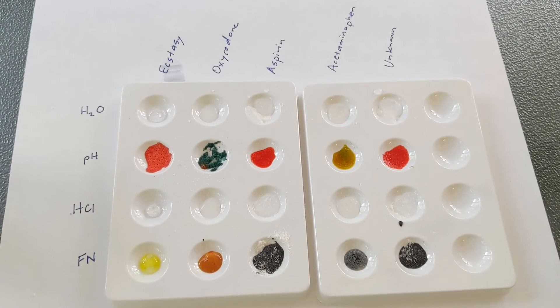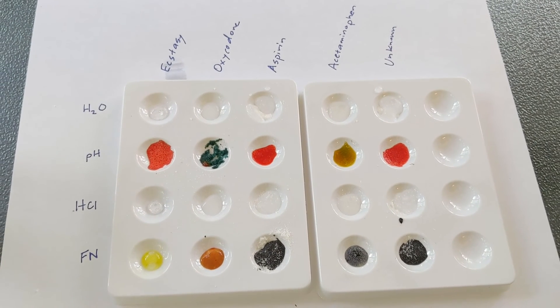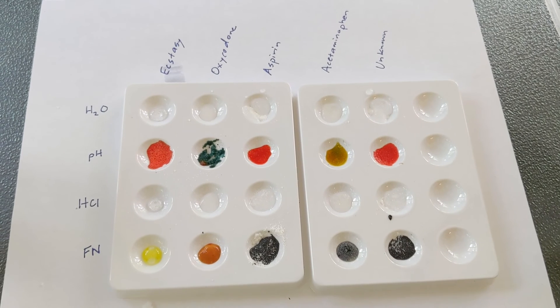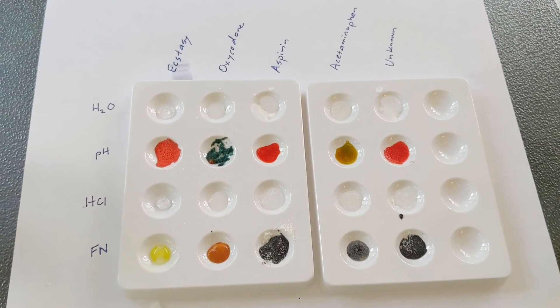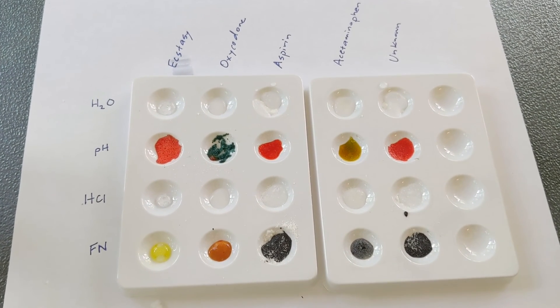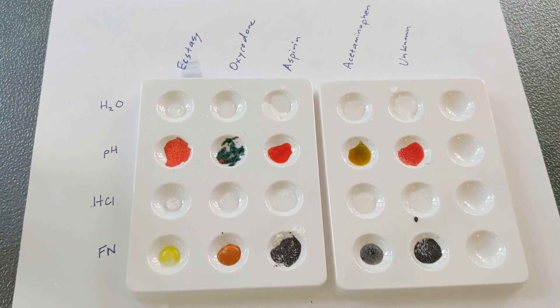Clean up your station. To do that, wipe out all of the wells with a paper towel, making sure the chemicals go in the trash can as best you can — it's better to have them go into a landfill than into the water system. Then thoroughly wash your plates, rinse them really well and allow them to dry. The toothpicks will need to be thrown in the trash and the little scoops will need to be washed and reused. Now you've had the chance to play the role of a forensic toxicologist and forensic chemist, and I hope you were successful in figuring out the identity of the unknown substance.